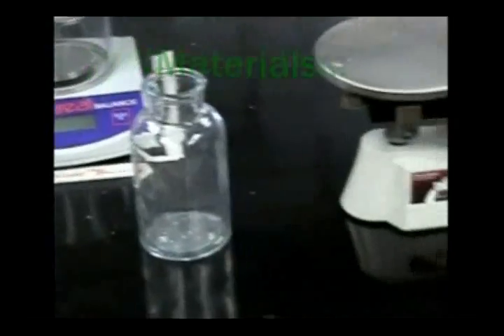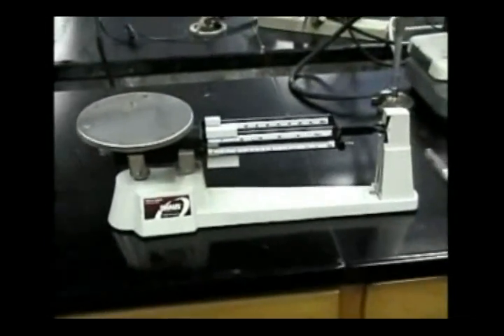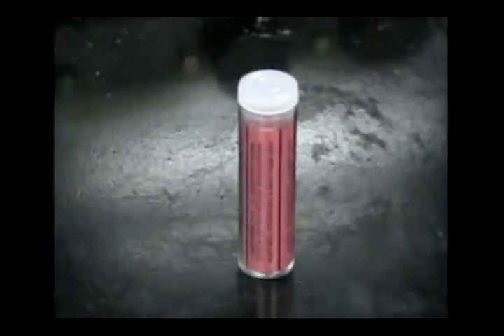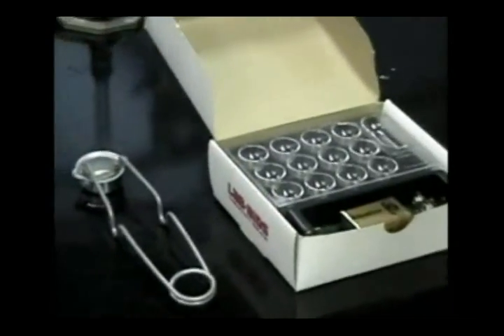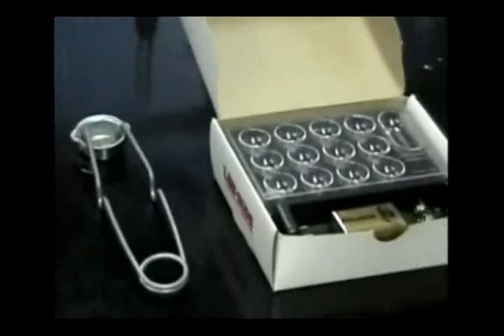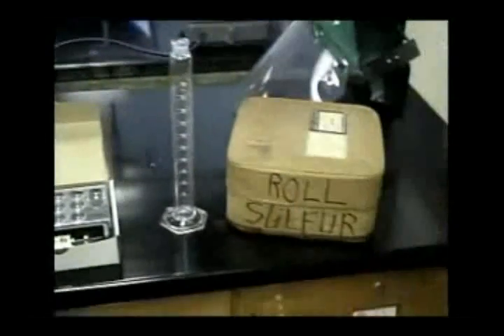Materials needed: glass bottle, triple beam balance, thermometer, red litmus paper, blue litmus paper, magnesium ribbon, plastic strip, conductivity tester, 100 milliliter graduated cylinder, and sulfur.